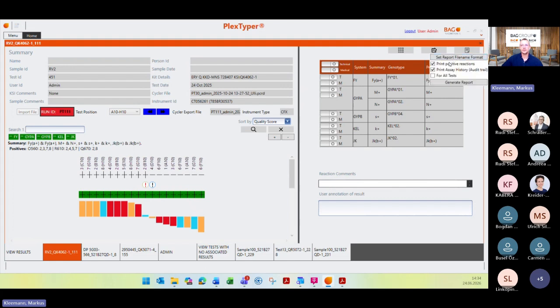You can then generate a report for all of your tests or just for this reaction here, so for this sample. And what you also can do, with this tick here, is choose whether you want to have this audit trail in your report or not. For me it's interesting, and most of the customers also use this, because you can see what the people did, whether they did the technical and medical validation, and which people created the layout or not. So this is also interesting.